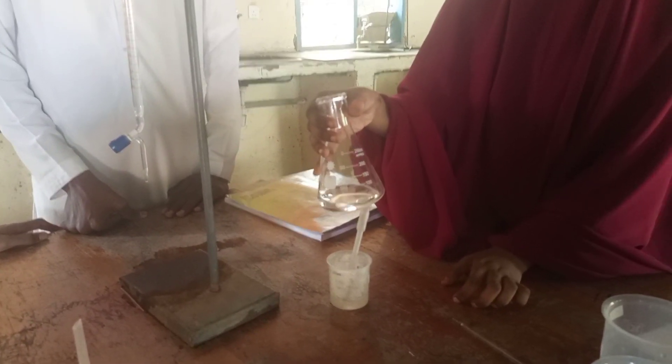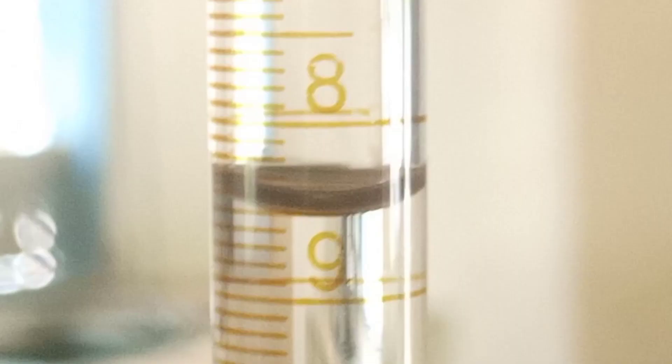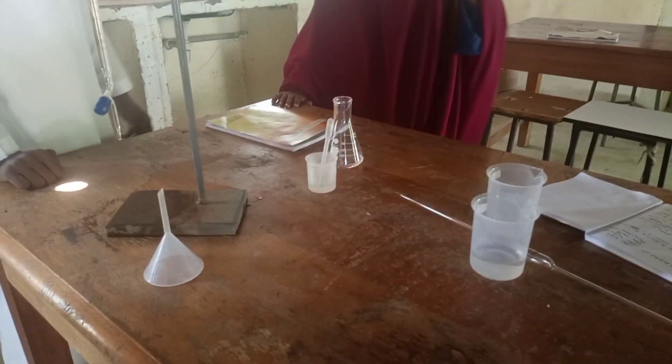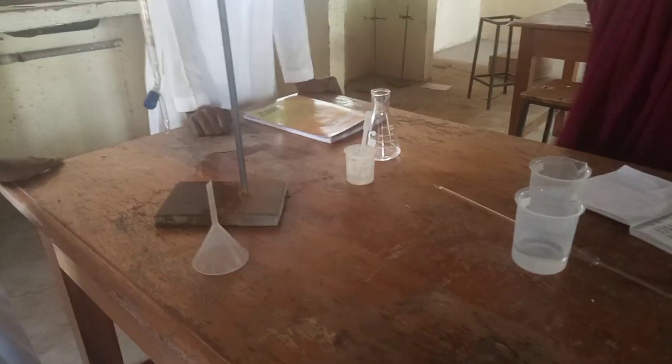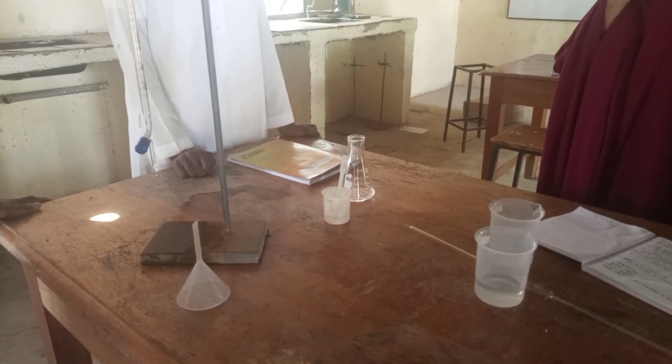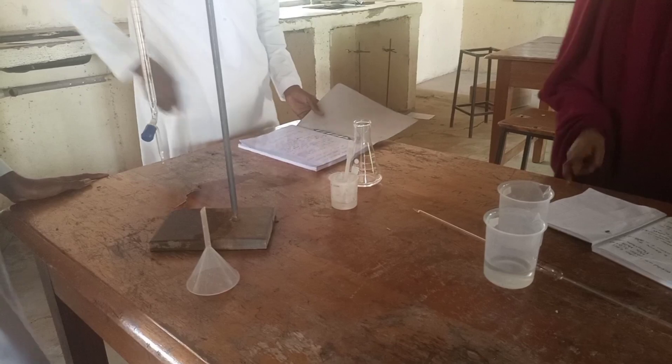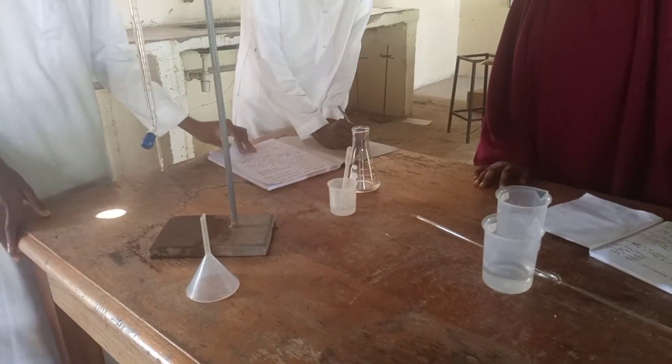From there, we determine the volume of the titer. Always check the lower meniscus. So that is — is it 8.4, 8.3, or 8.5? You can see the titer volume here is 8.5 ml. You can repeat the procedure two more times to get the accurate volume, but our volume at the end point is 8.5 ml.